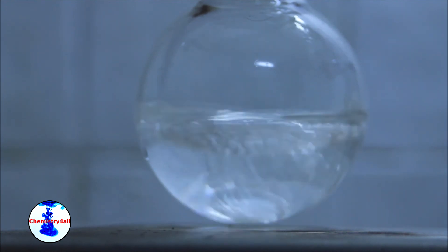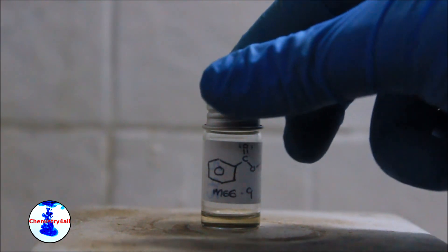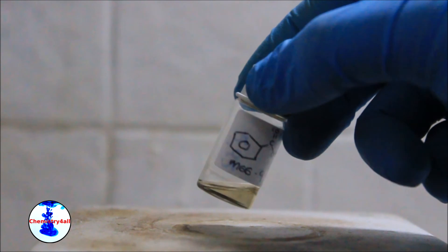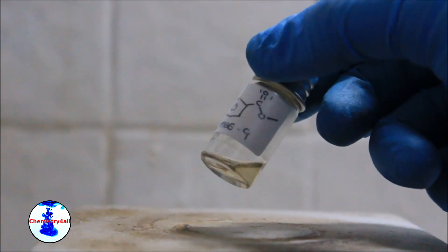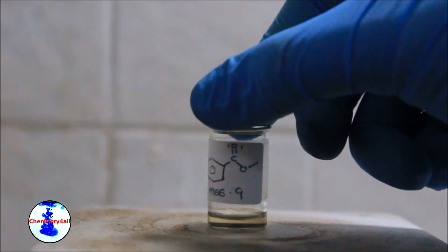Finally, I've obtained 1.30 grams of pure methyl benzoate, which represents an 81% yield. Notice that the final product looks slightly yellow due to the presence of an organic impurity in the flask used, however this is not a big deal for me so I decided not to purify it.